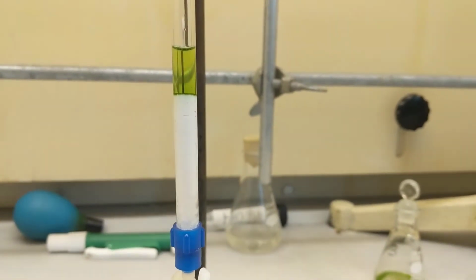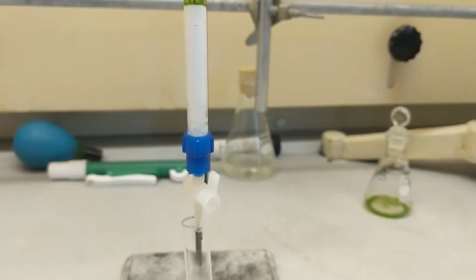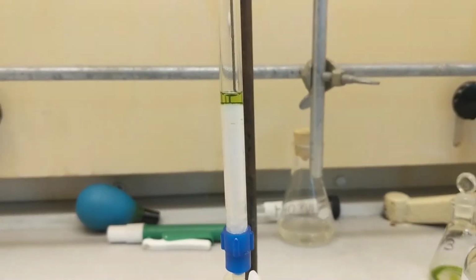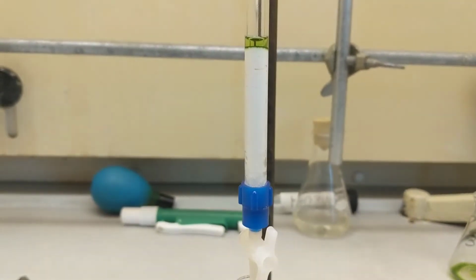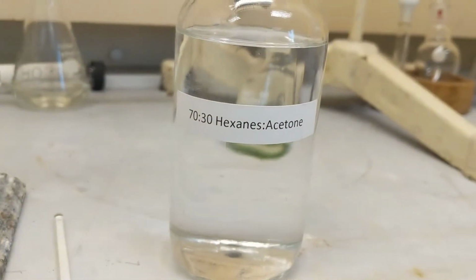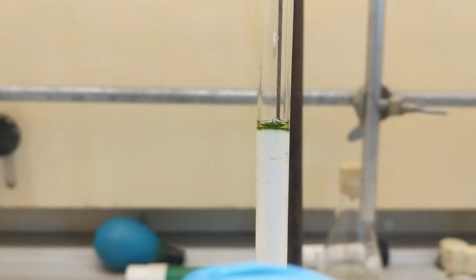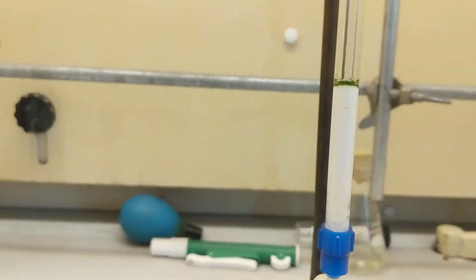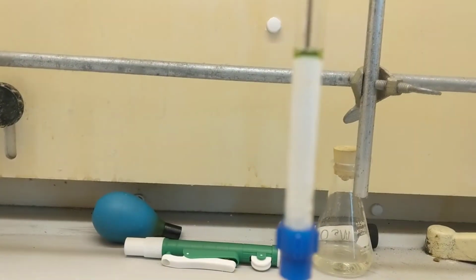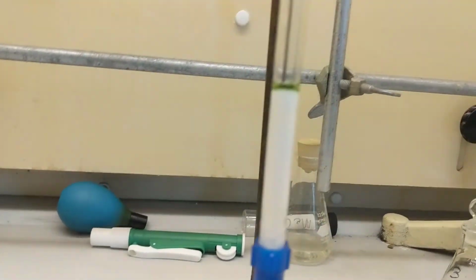solvent, 70-30 ratio of hexane and acetone. I'll keep y'all updated. So I've added 4 milliliters, let it run down, not getting a yellow band. Oh well. So what I'm going to do is add about 4 milliliters of that, a little more polar, into here. Oops, let me stop. Oop, don't want to let it go dry, remember? So, as you can see, I have all my pigments still sitting up there, no yellow band. So what we're about to do is add a more polar solvent, see if we can get a band out.